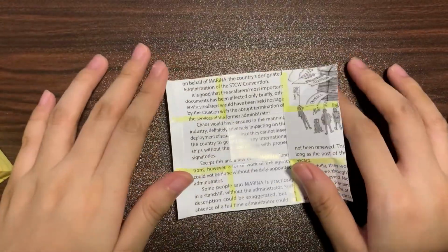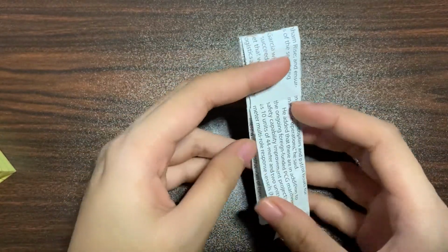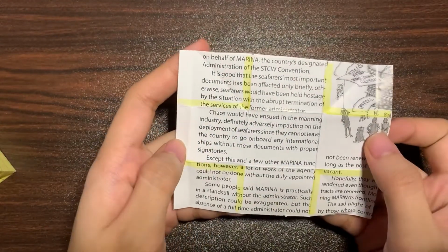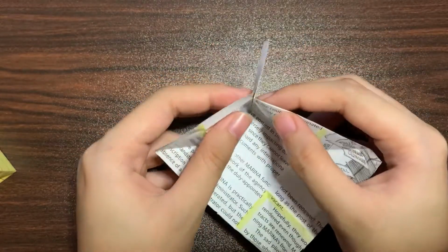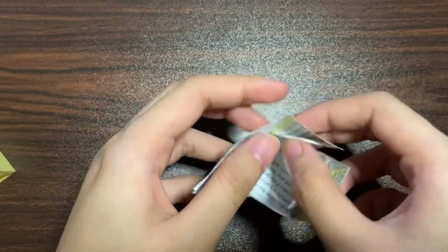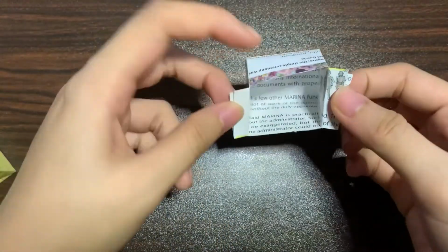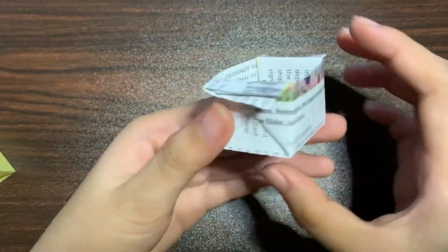After that, you fold it 3 times lengthwise as well as 3 times crosswise. By now, we have 9 boxes, and we now fold the corner boxes and let the perpendicular lines meet. The 4 flaps will now be folded towards each other, and the resulting flaps will be folded outwards. And now, we have an improvised cassette for our specimen.